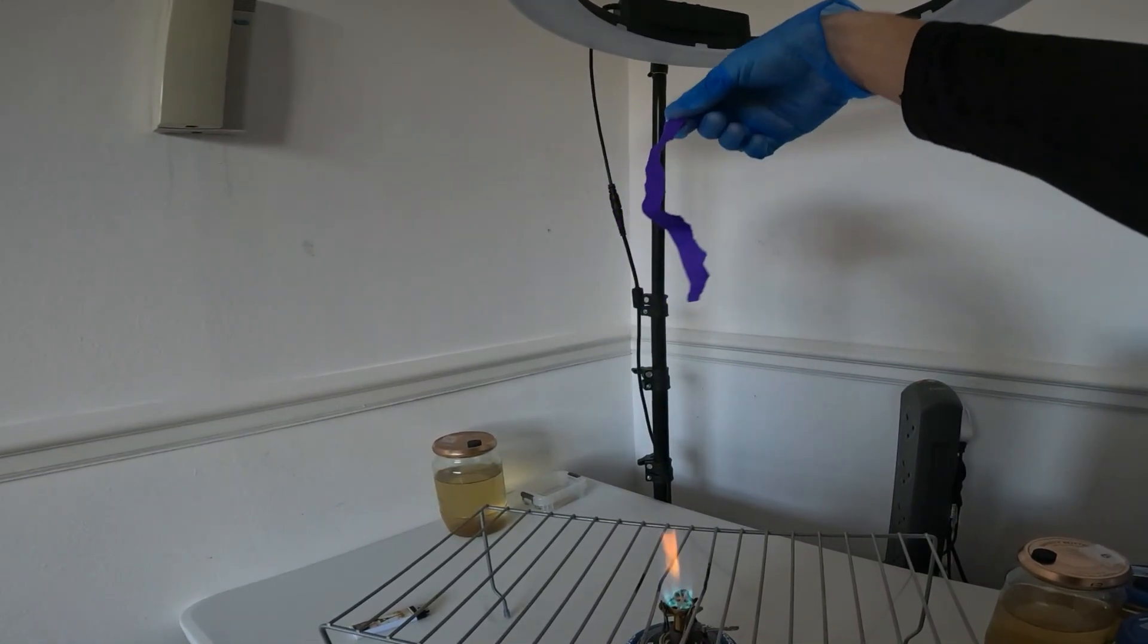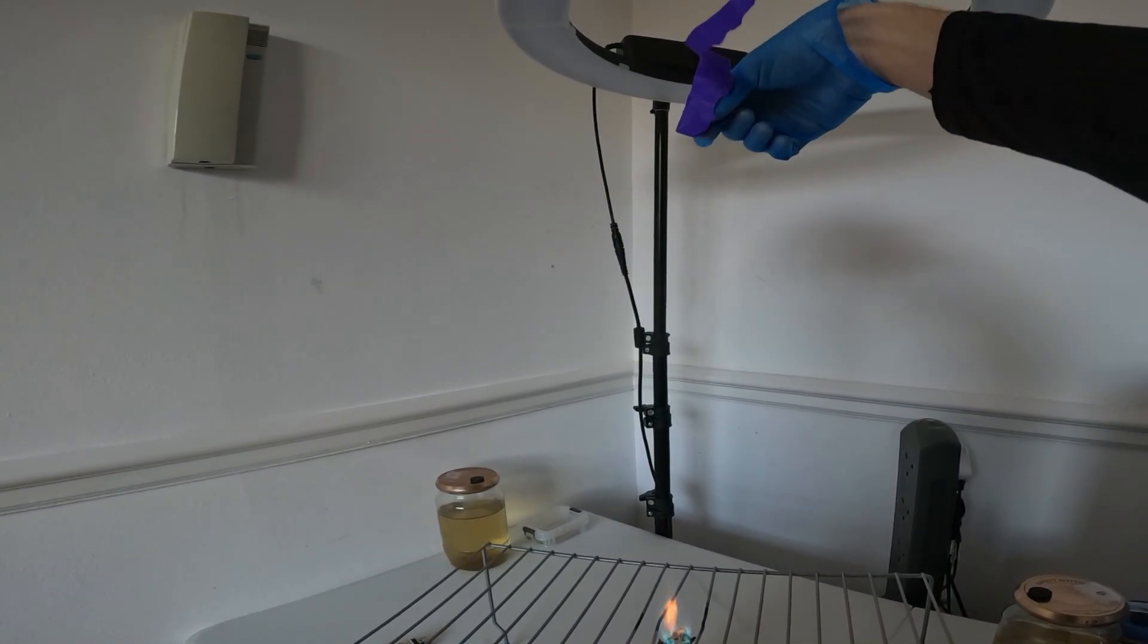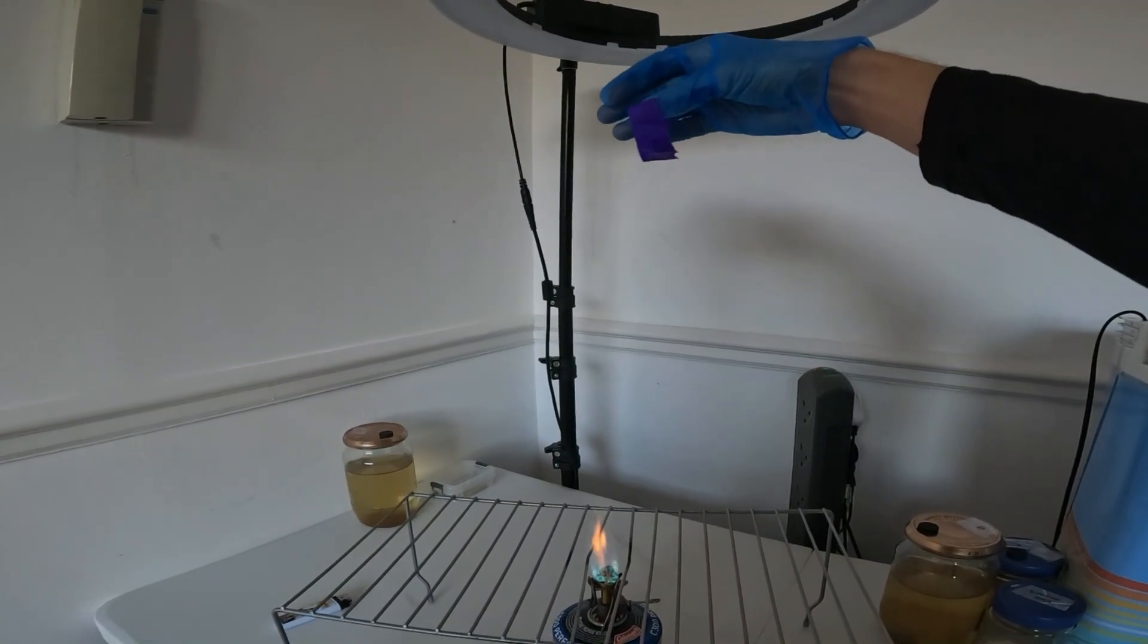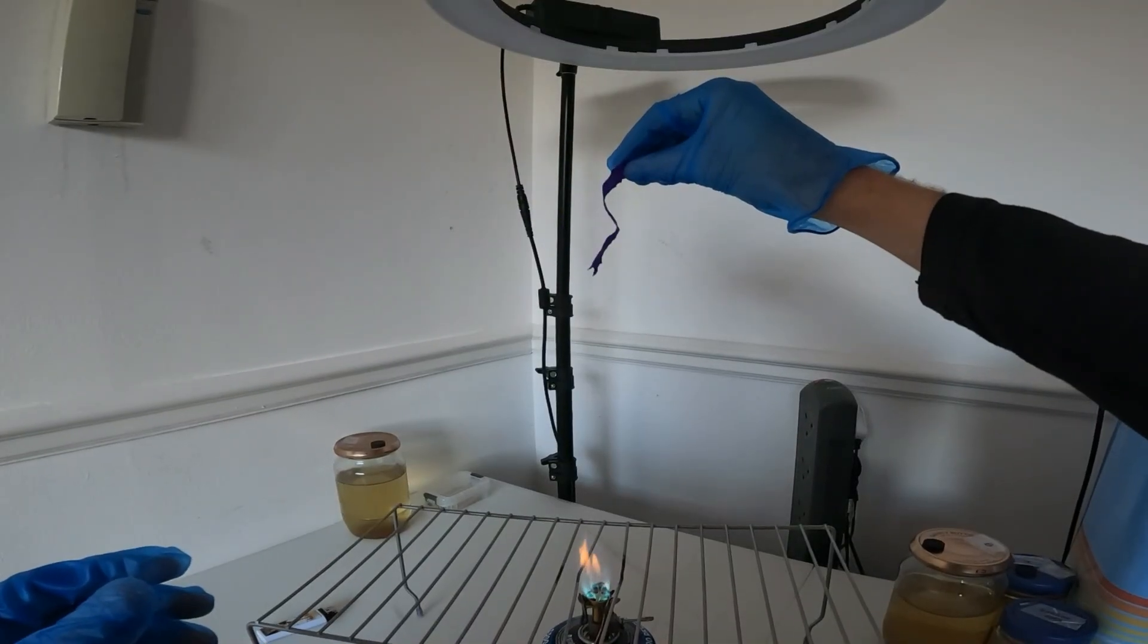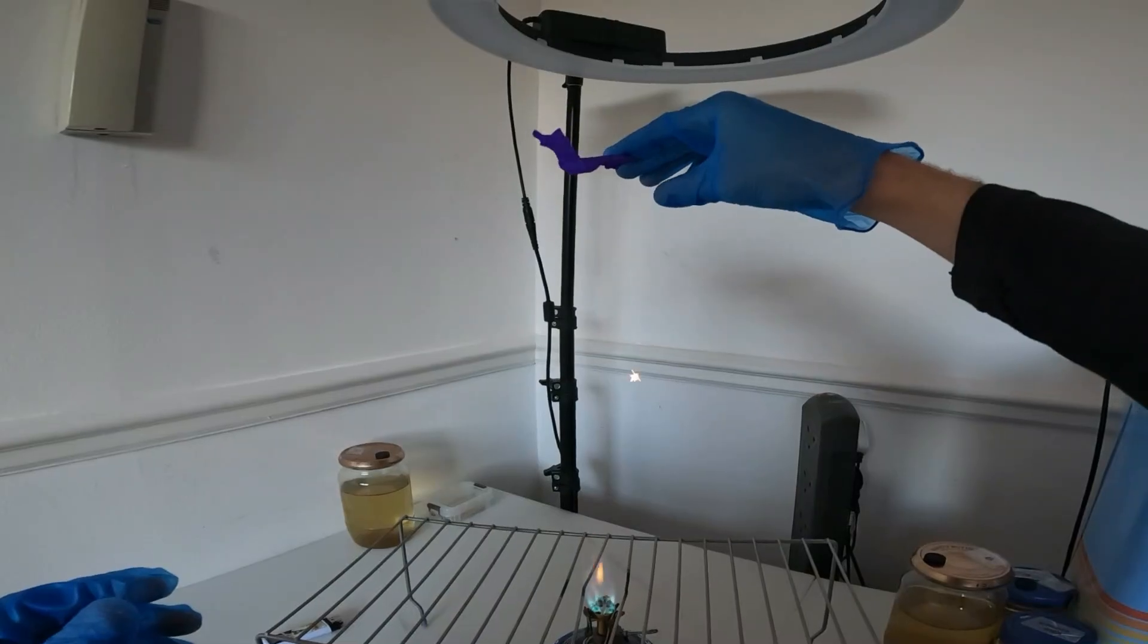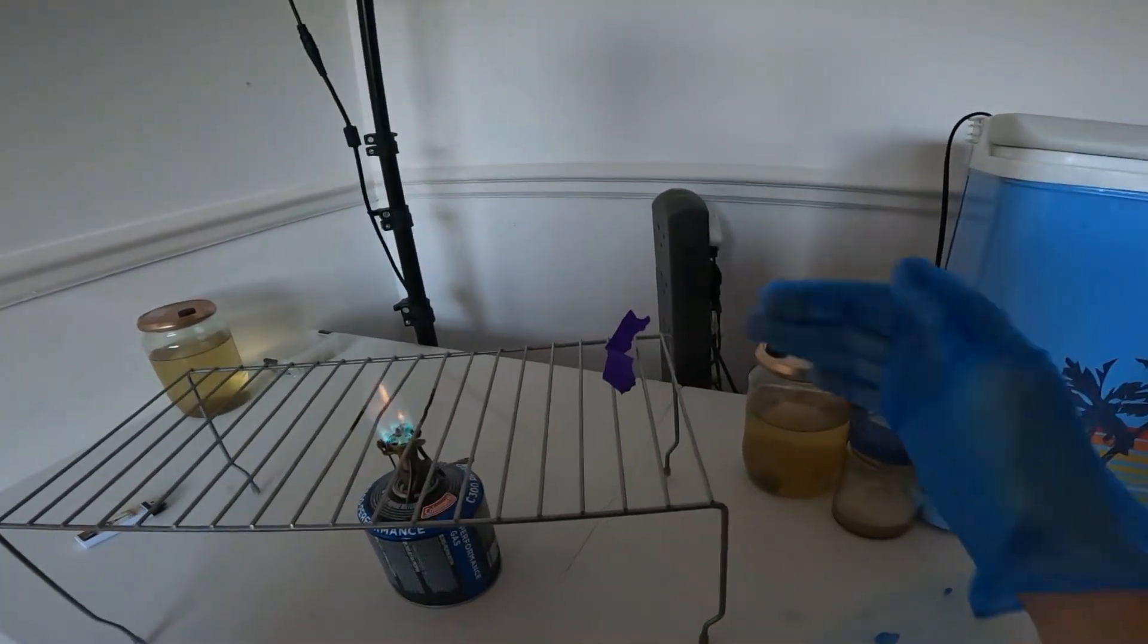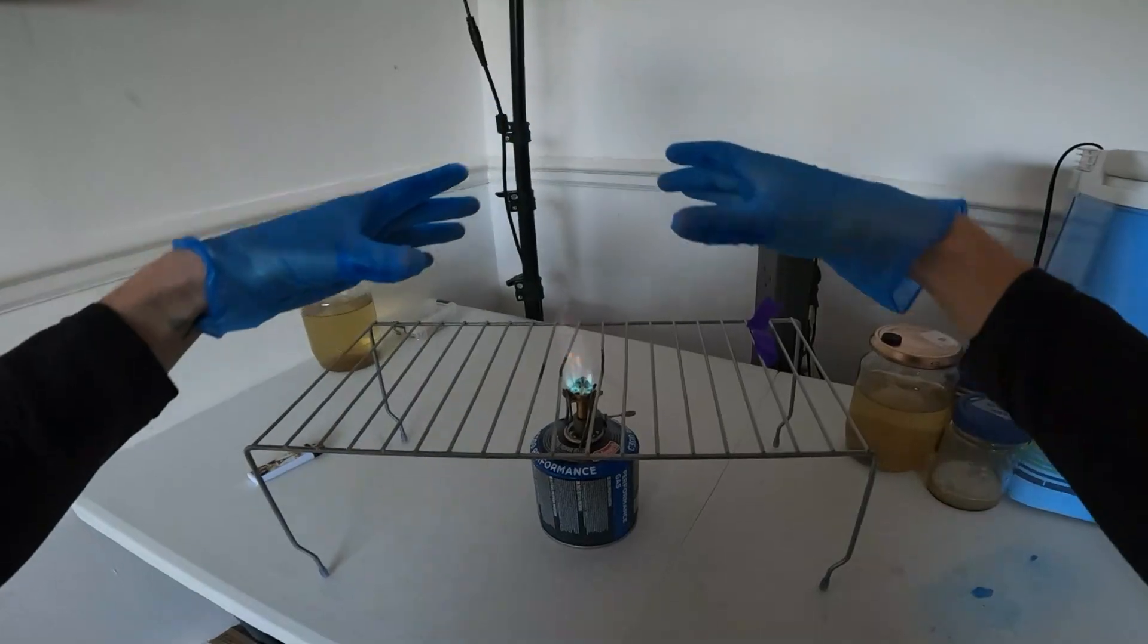And then I did a couple of other tests where I would drop chunks of this paper and see where it would land, and every time it would land just outside of that safe working zone that I had already established.